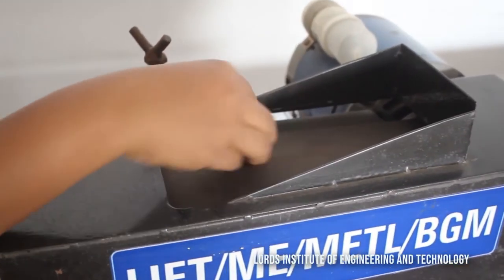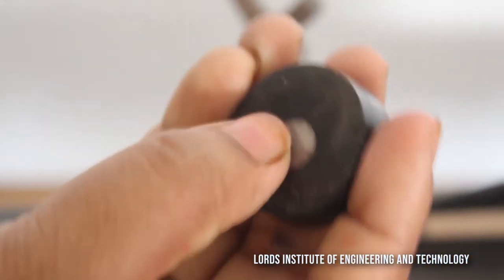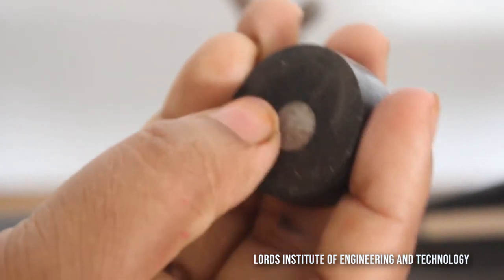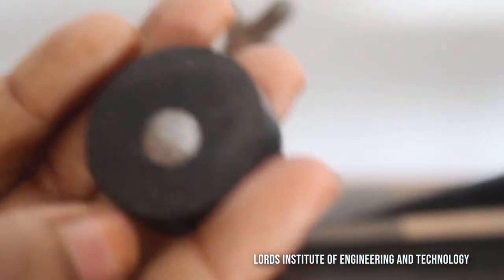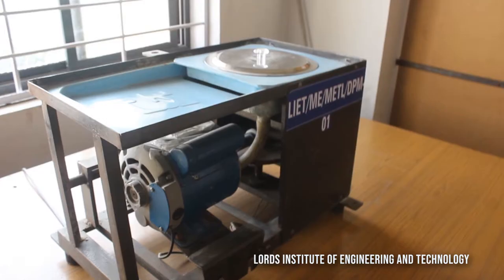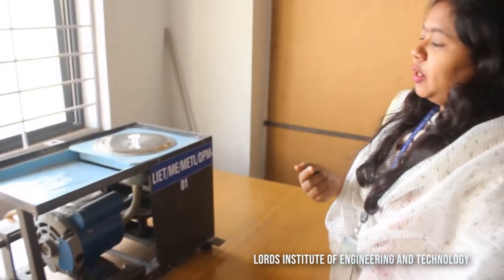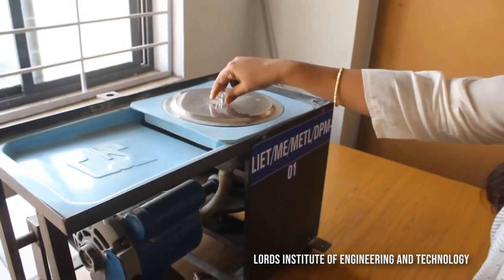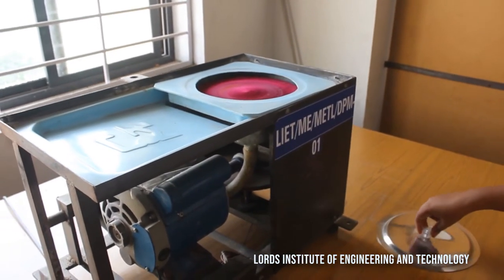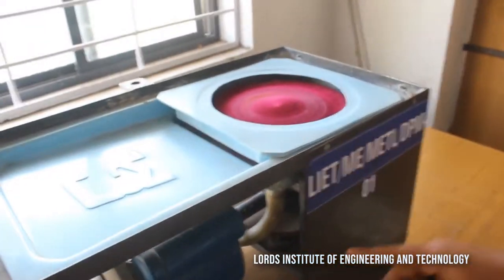After grinding is done, we go for refining the grain structure. You cannot find the same structure after grinding as it is now more defined. Now let us go for the polishing machine. As we have done the grinding operation, now we proceed with polishing on the polishing disc machine.